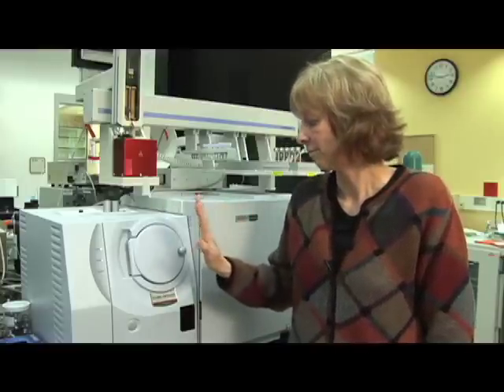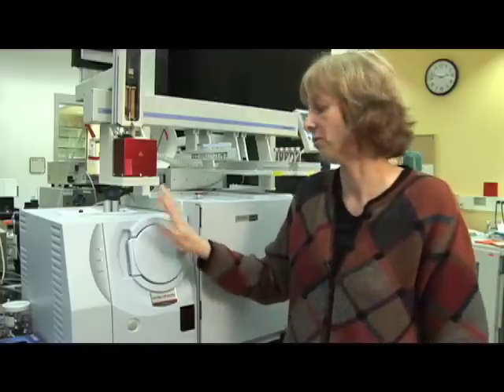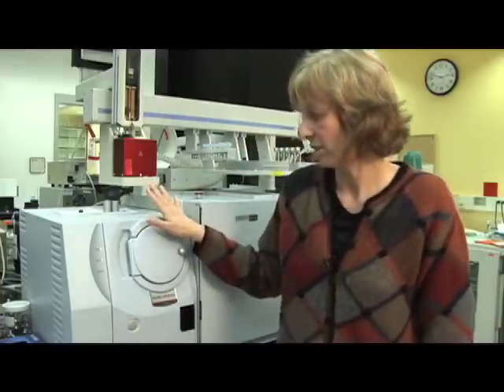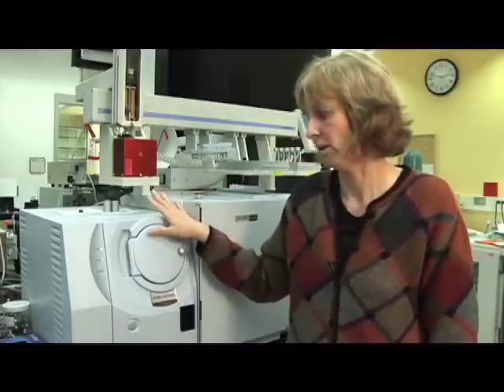So this is a mass spectrometer. I would love to open this to show you a little bit more, but it's running under vacuum and I can't break that vacuum, so we better leave it closed. But what I can tell you is when the molecules are entering the mass spectrometer, they're bombarded with electrons. And during that process, they're ionized. They're positively charged. They lose an electron, so a molecule is actually turned into a positively charged ion.